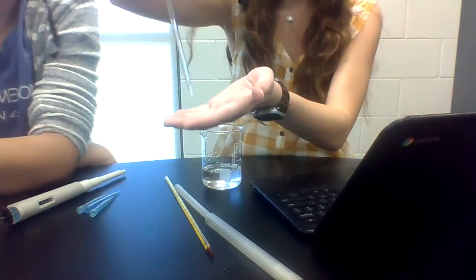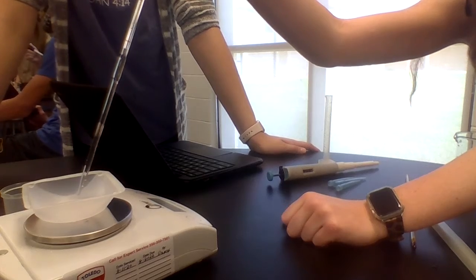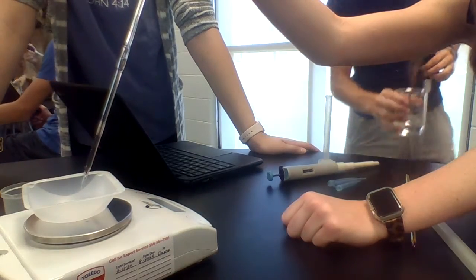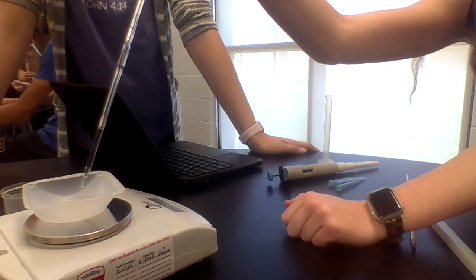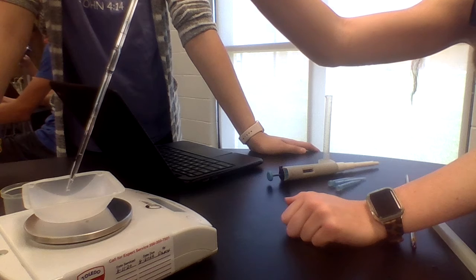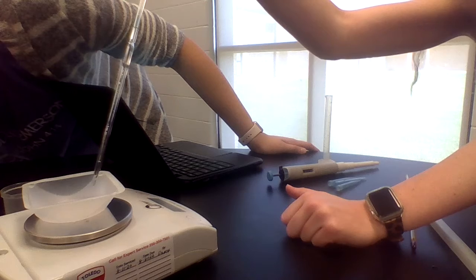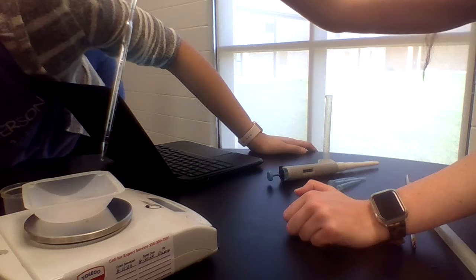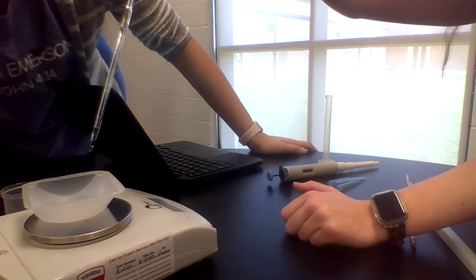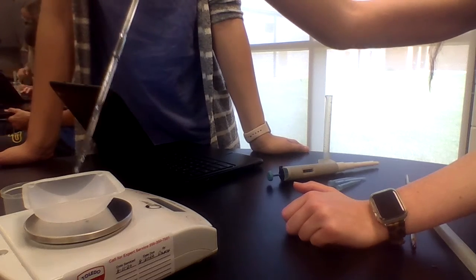Alright, move the camera to the thing. Now we're going to put it in here by pushing the trigger. Going in. This is a lot slower than I thought. It's almost there. Oh, it's not coming out. It's the glare. Or maybe it is out. Yeah, you got most of it out, close enough. If nothing else is coming out, then you're good.